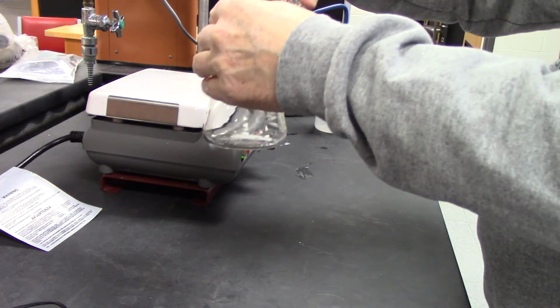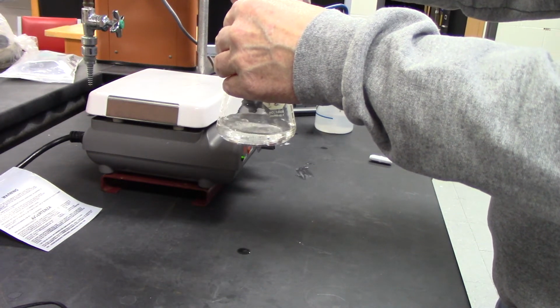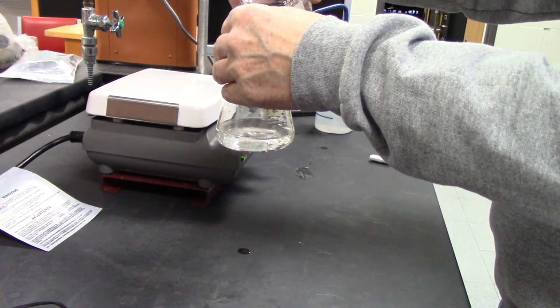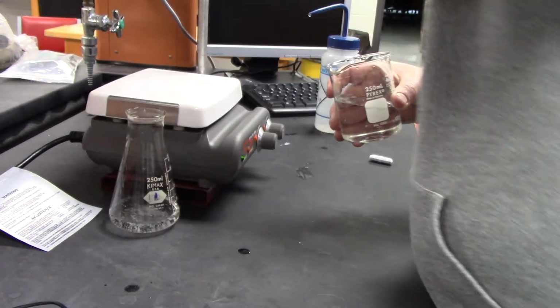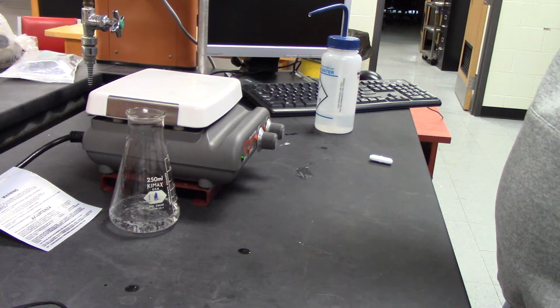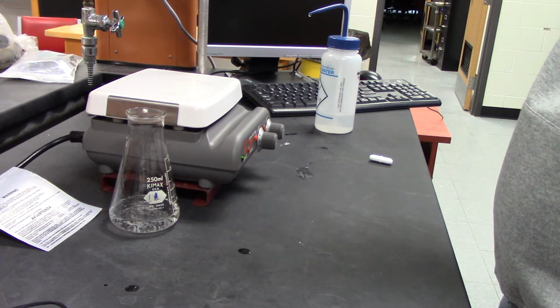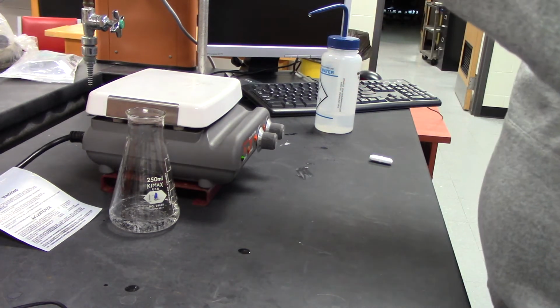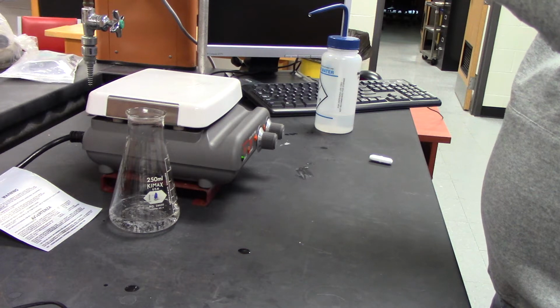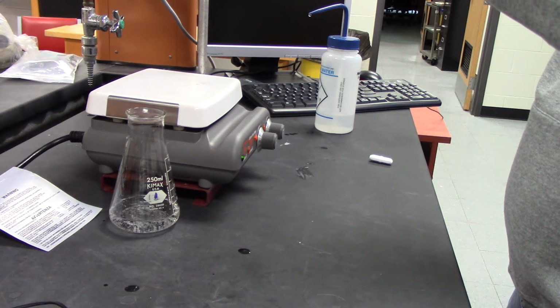So I'm just going to add it to where it says about 50. That's close. That's number one. Number two. Number three. Okay.